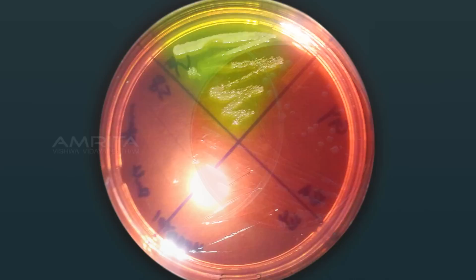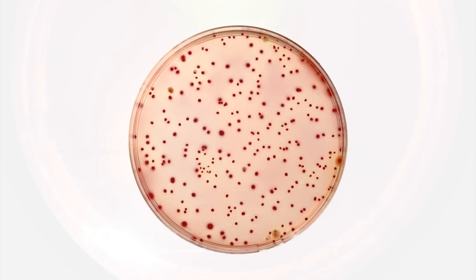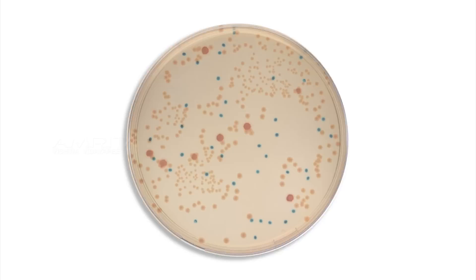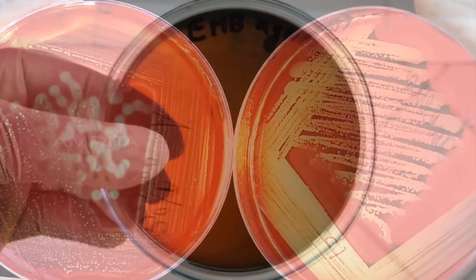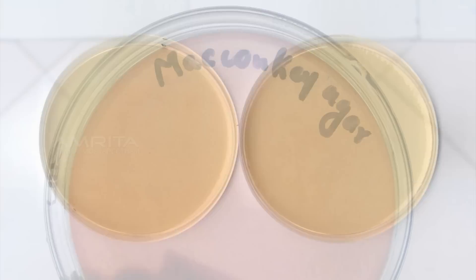Selective media allow certain types of organisms to grow while inhibiting the growth of others. Selective inhibition can be achieved by adding dyes, antibiotics, salts, or specific inhibitors which affect the metabolism or enzyme systems of the organisms. Examples include Eosin-methylene blue agar, mannitol salt agar, Hektoen enteric agar, and phenyl ethyl alcohol agar.